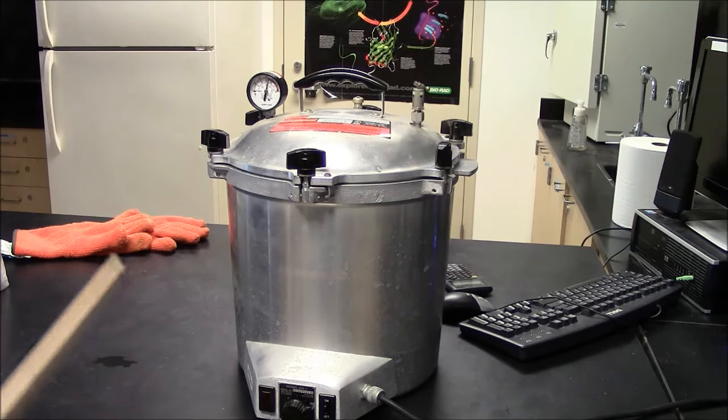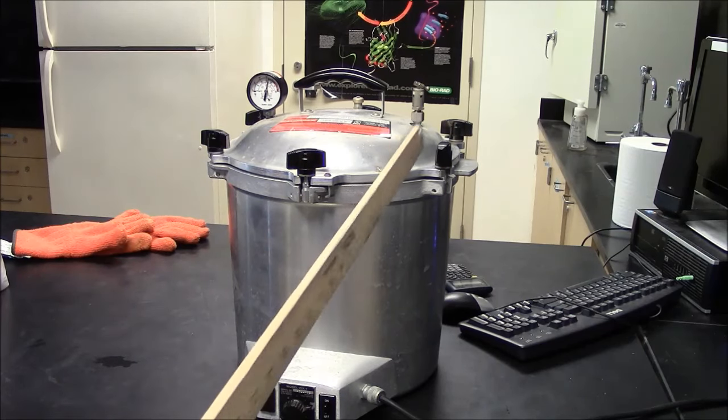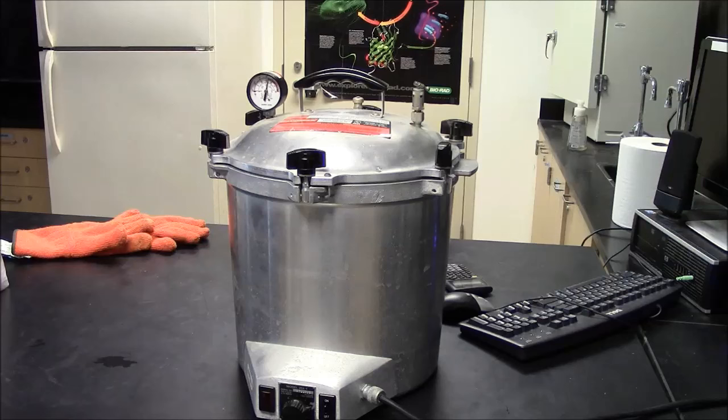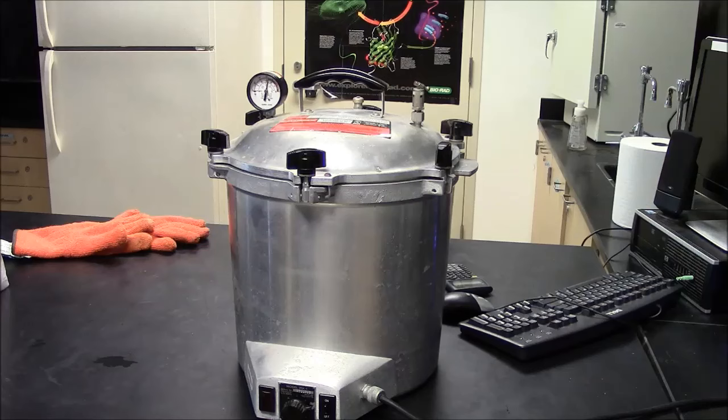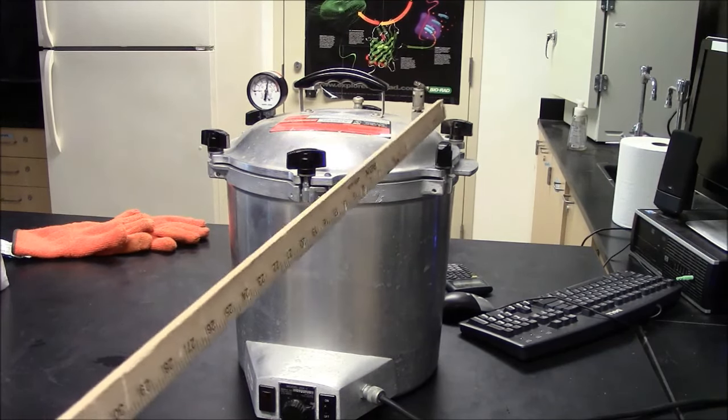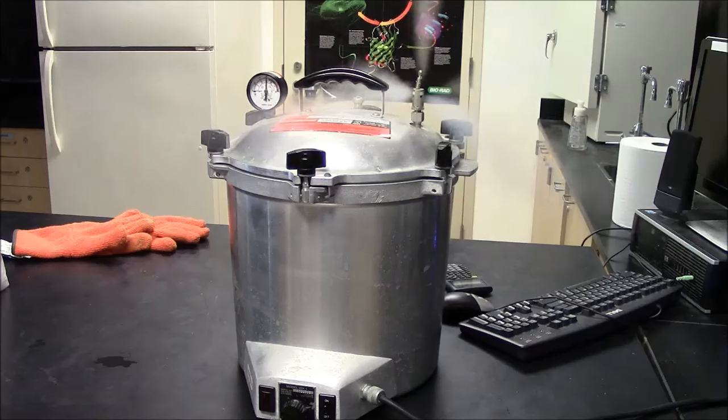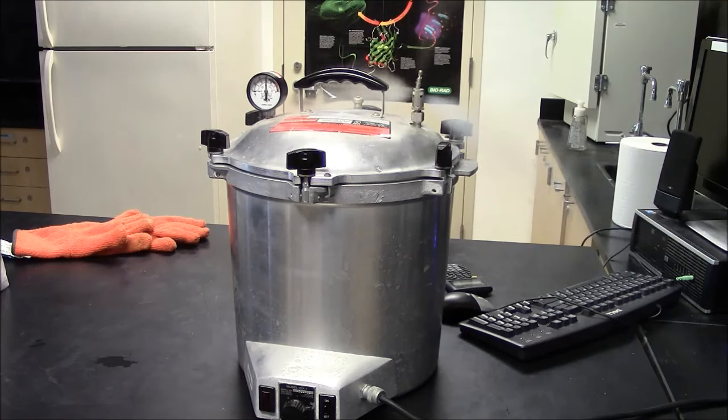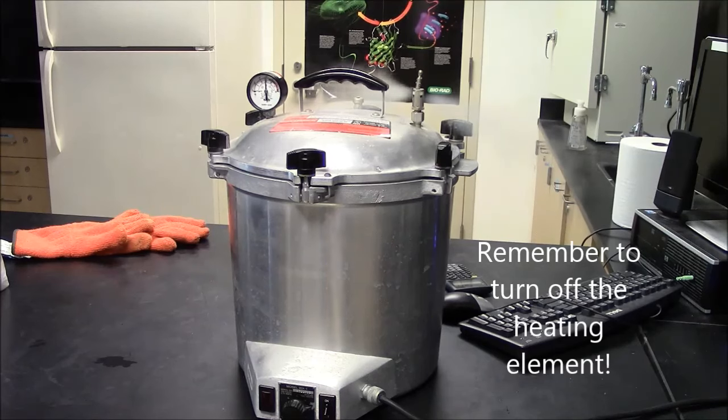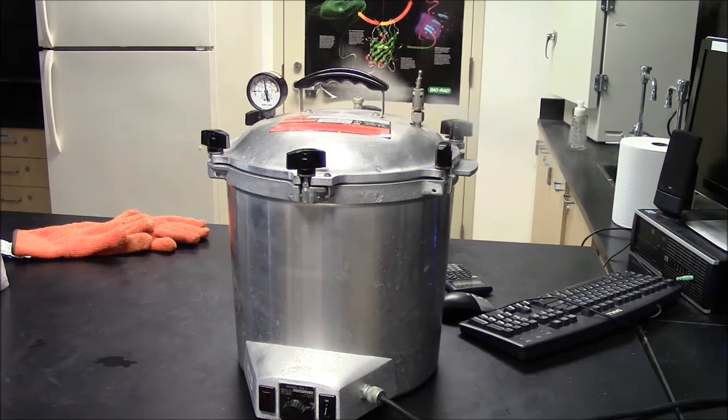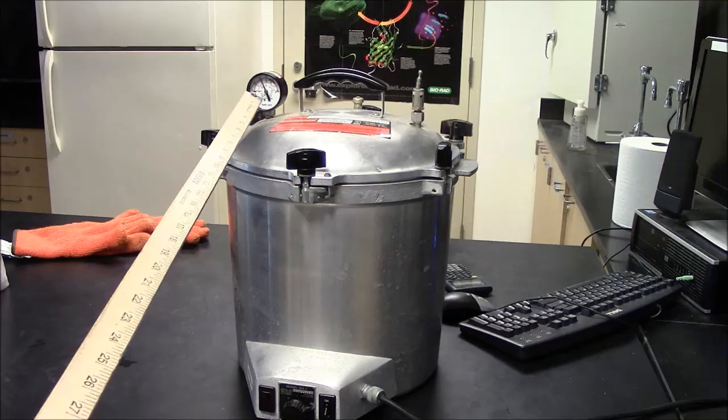That's my timer saying this has been sterilizing for about a half hour. So now I'm ready to release the pressure. When I do this, it will fill the room with steam, so I will turn on the exhaust fan before I flip the valve. The pressure is dropping here.